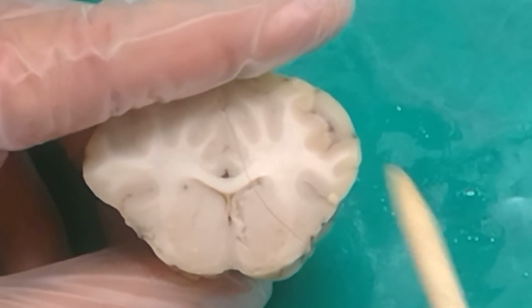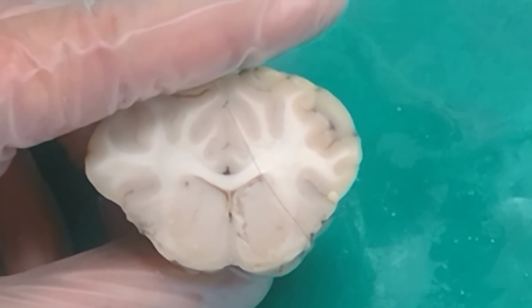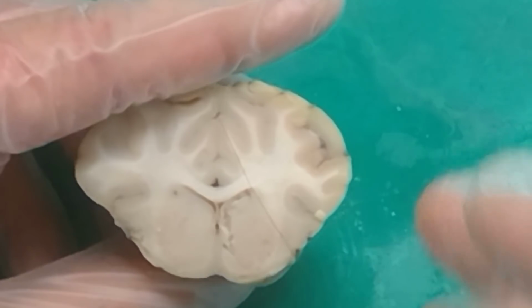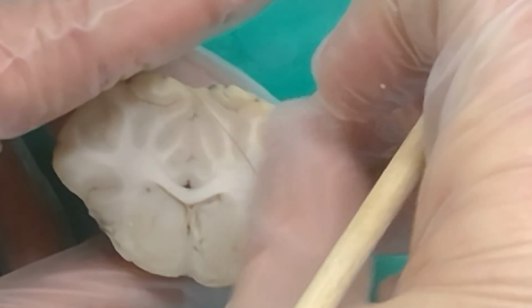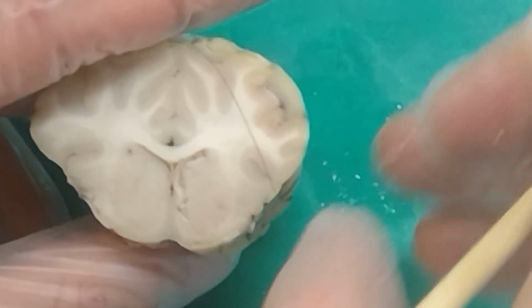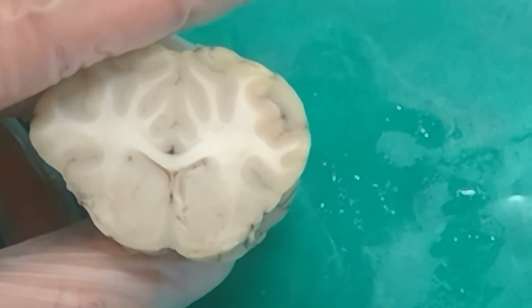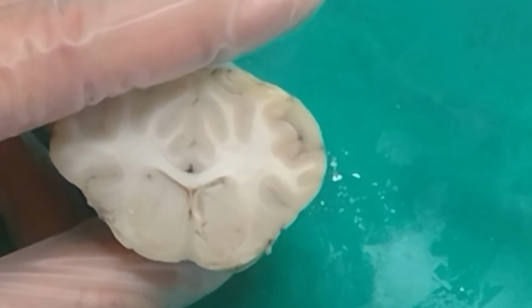So here, from this very first cut, we're just going to go through what we can see with each one of these. What are these? Ew, there's a hair on my brain. Whose hair is this? You can have it back. I just pull my hair out, stick it in the brain jar.